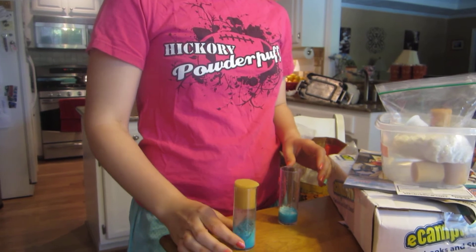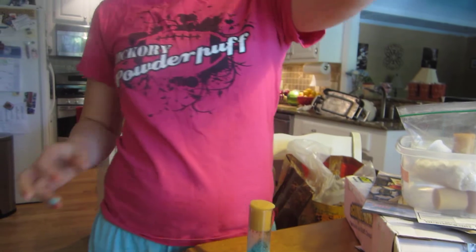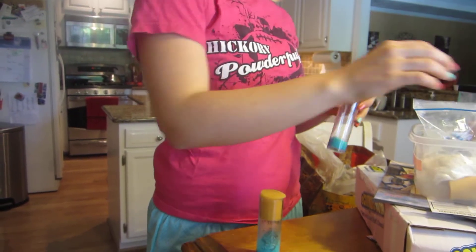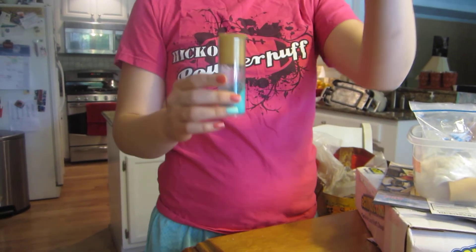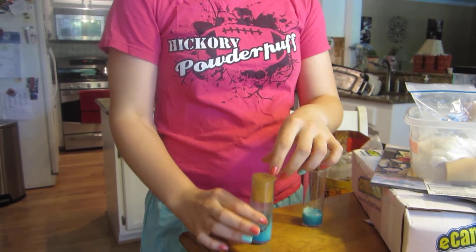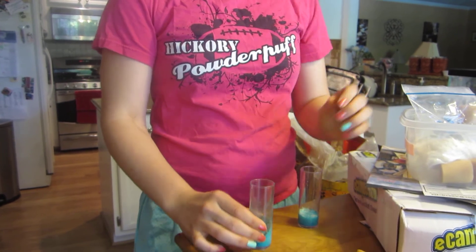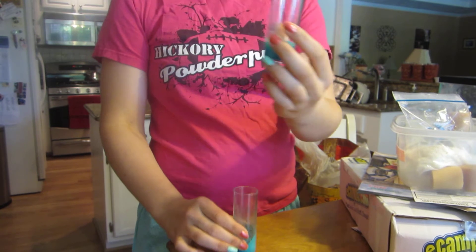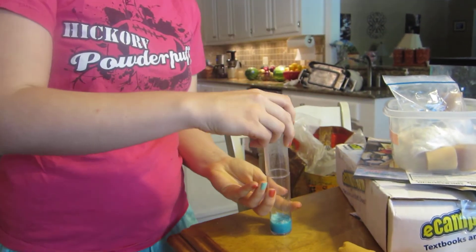I'm going to continuously tap this, and in this new vial I have my new medium. This is just fruit fly medium — you add water to it and put it in your vial. So I have some in here, and I'm going to tap this continuously, then take the top off, put it over top, switch the whole thing over, and then tap more.